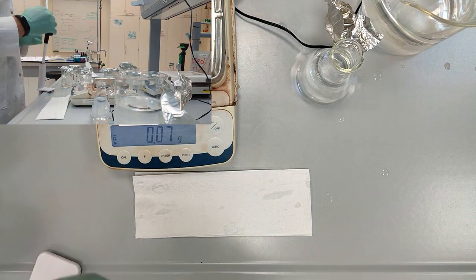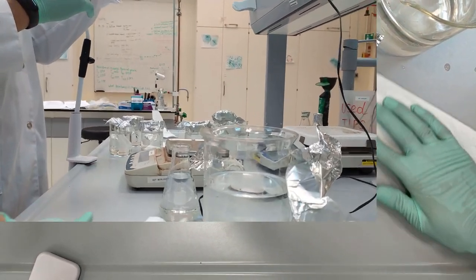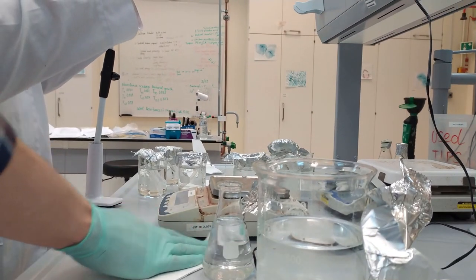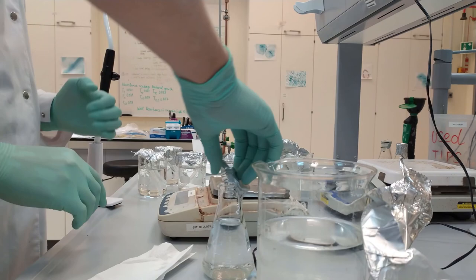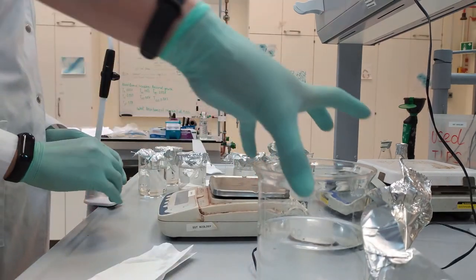We leave all these beakers at room temperature for 45 minutes. And of course, you need to clean the bench before you leave.